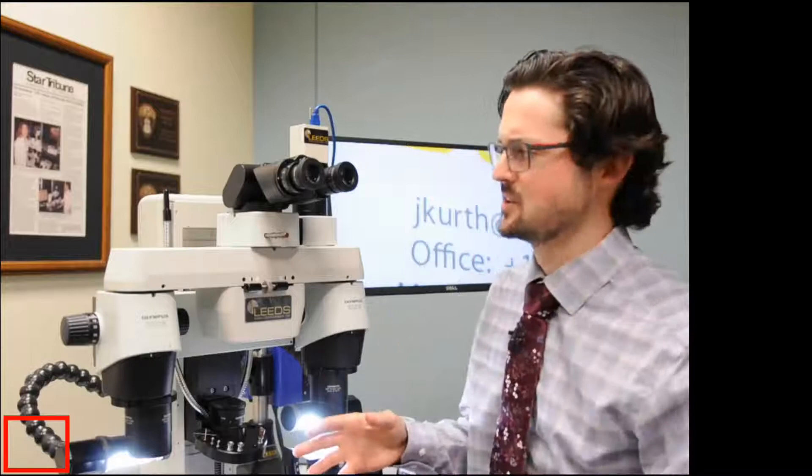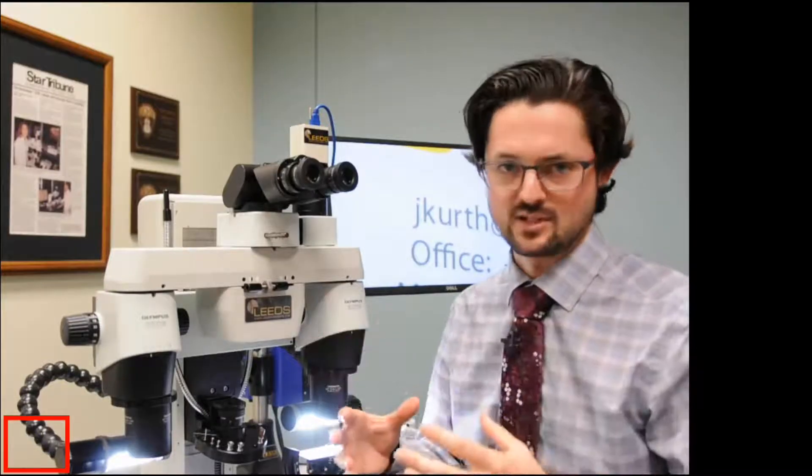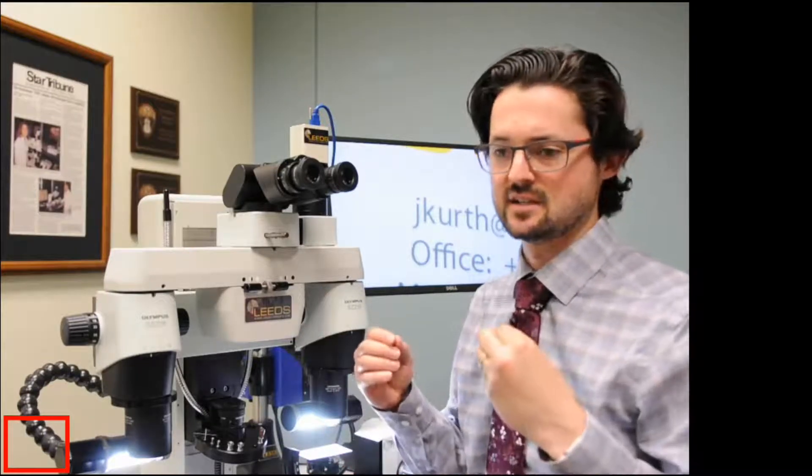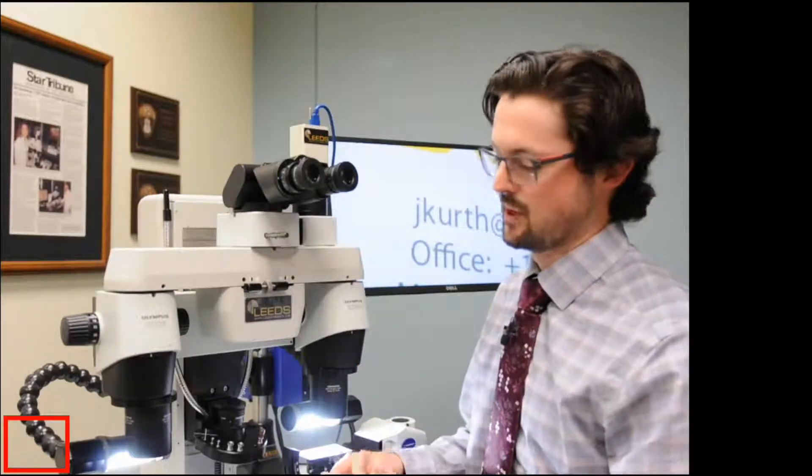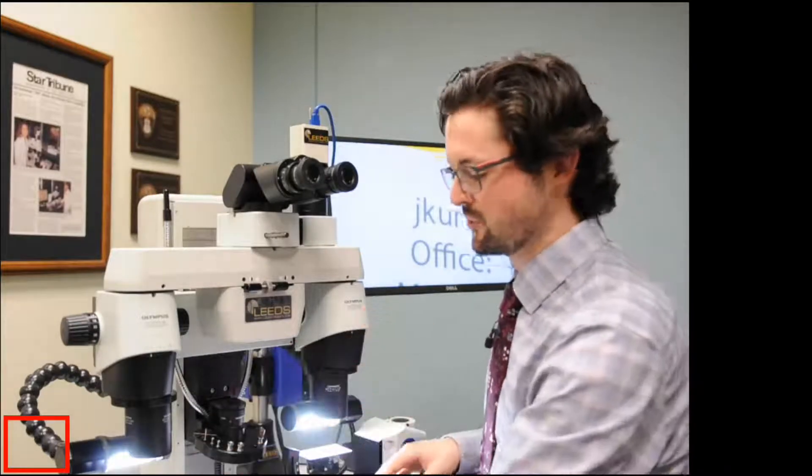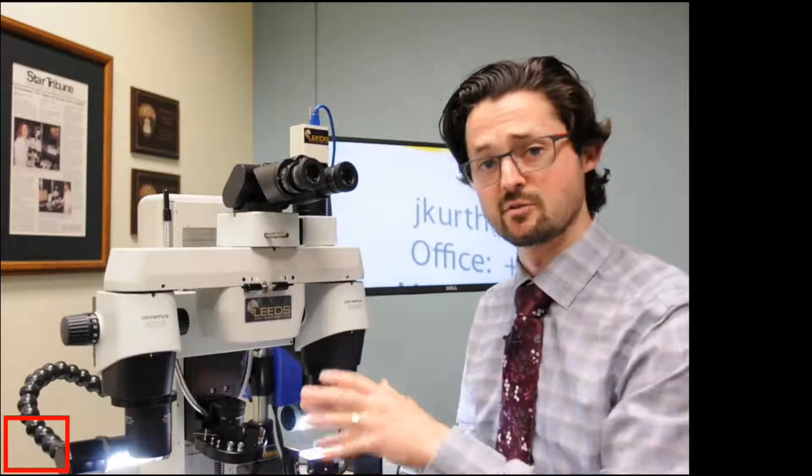And the big advantage of doing this and getting these numbers dialed in is, like I said before, it's about when you zoom in, focus. When you zoom out, everything remains in focus.